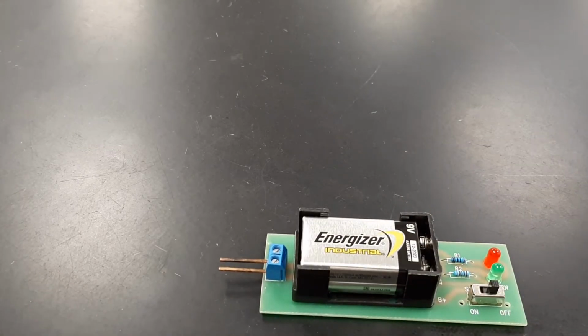So for the Conductivity Lab, first you will need to make a prediction for each of these substances on the substances list. After that, you'll be using a conductivity meter to determine if a substance is conductive or an insulator. So a conductor or an insulator.